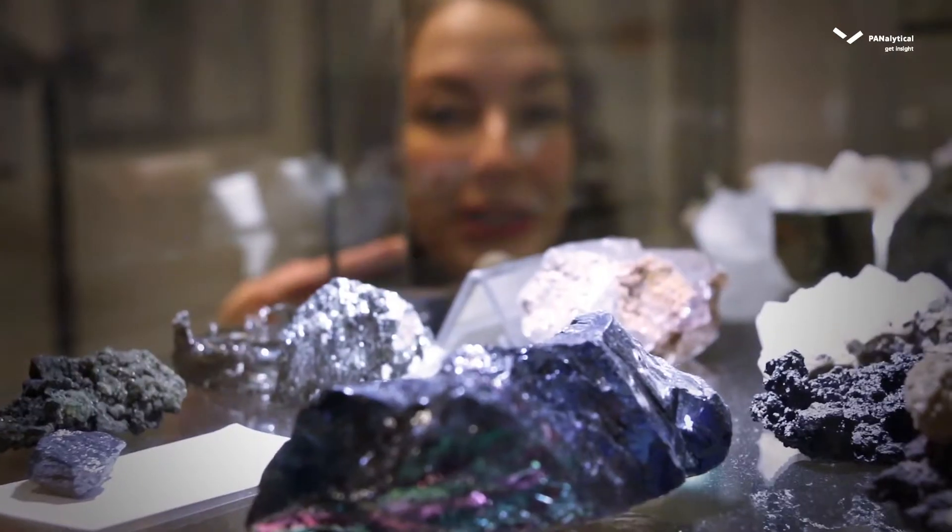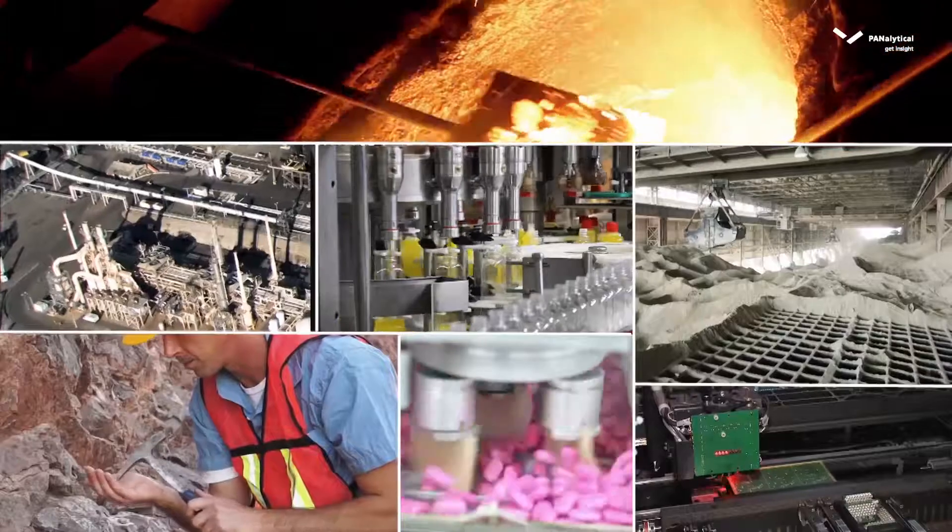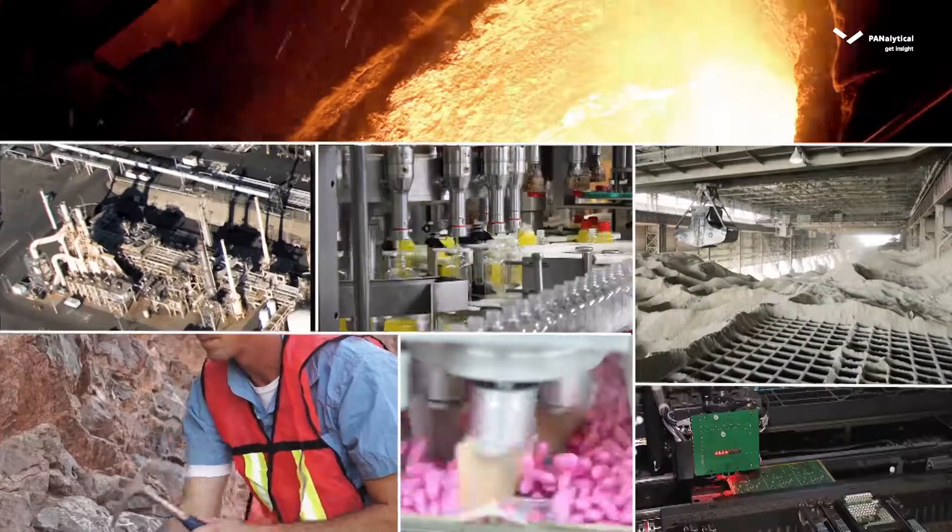You can use XRF not only for the analysis of steel, but also for many other materials like plastics, petrochemicals, building materials, chips and electronics, minerals, food, and many, many more.